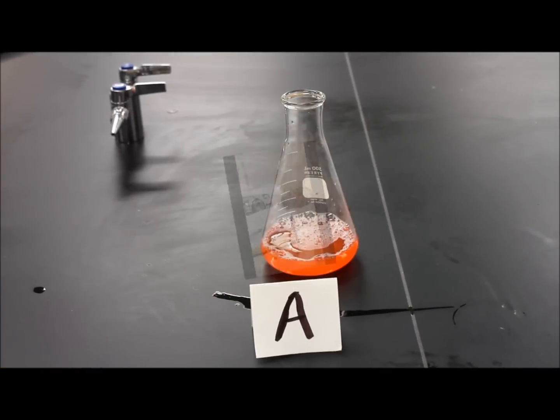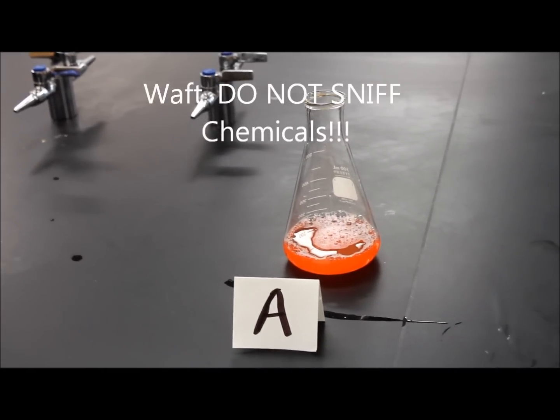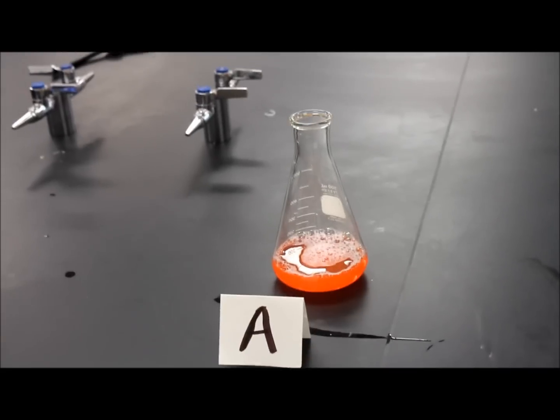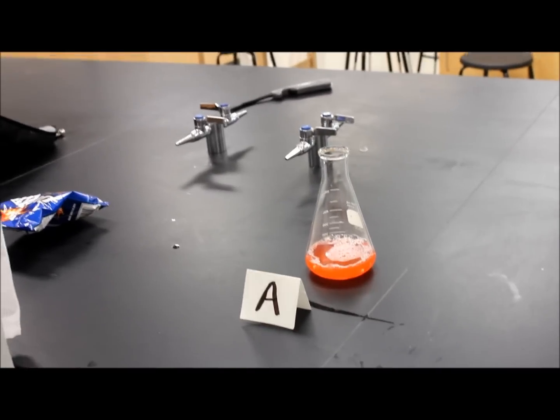Just created a new compound, compound A. I don't know what it smells like, but we'll have to find out. Rule number 5, always waft, not sniff. I mean, I never took a lab safety class, so what do you want me to do? This is, kids, why you should not sniff.